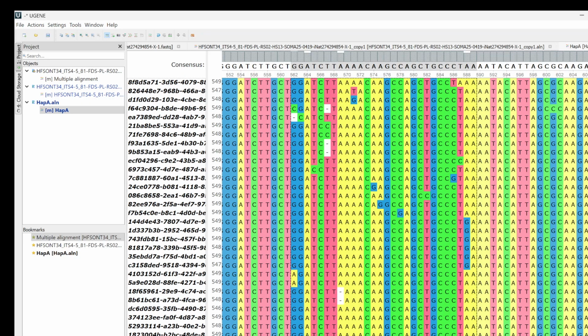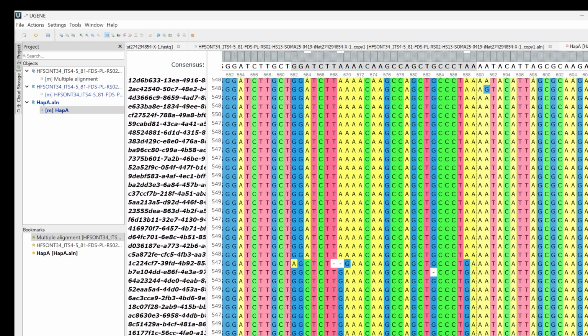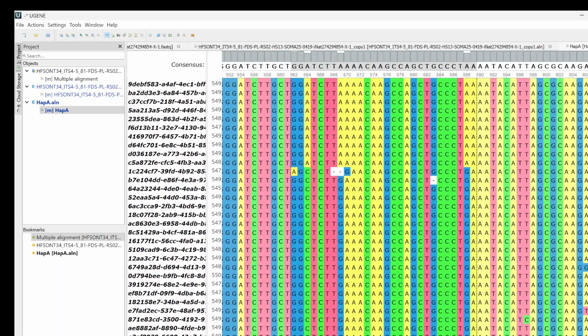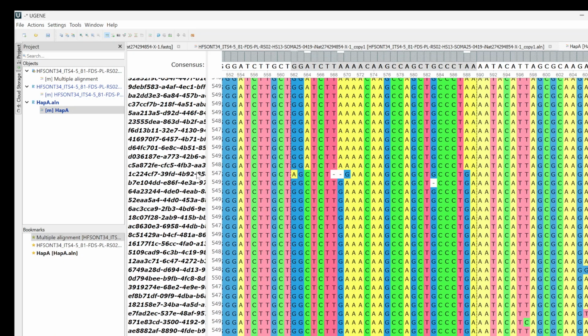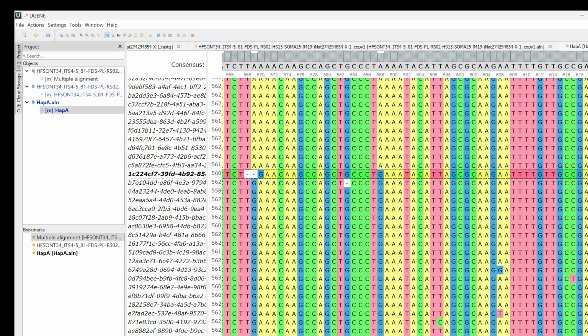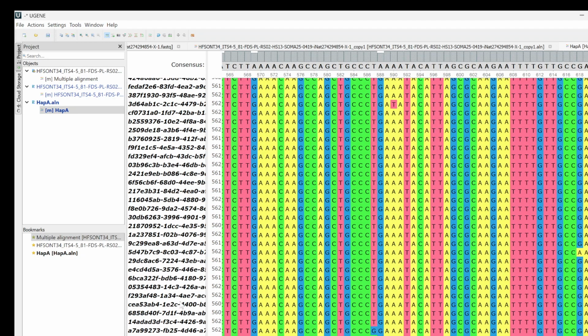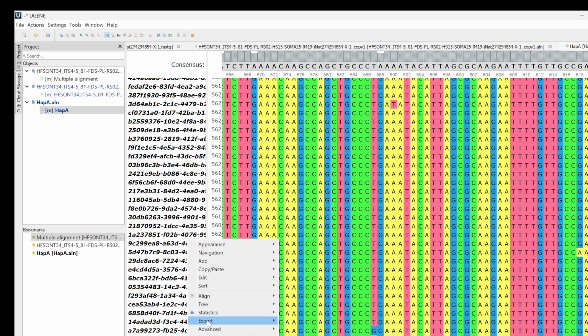Looks like it did some rearrangement, and we have this other chunk happening down here. And so we can do the same thing. We can pull this out. Again, we're going to right-click, export. Oh, that's not what I want to do. That's okay. Create new alignment.